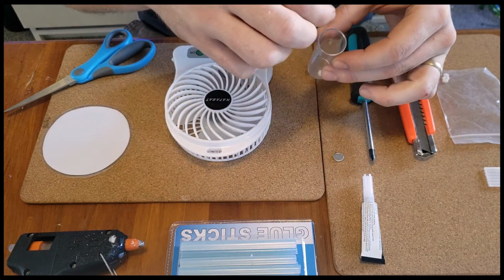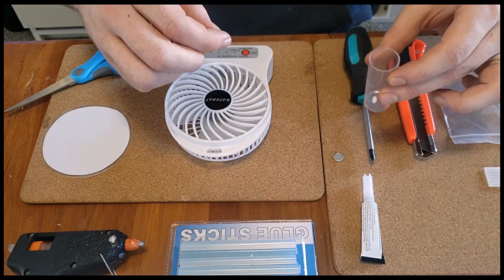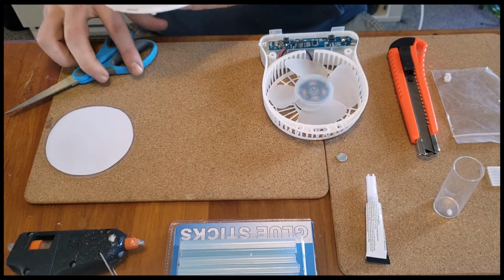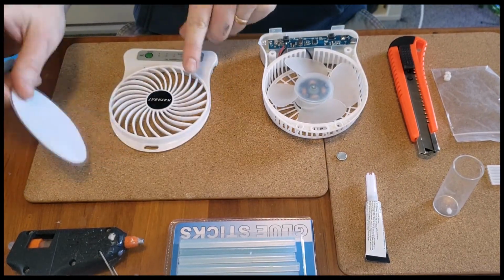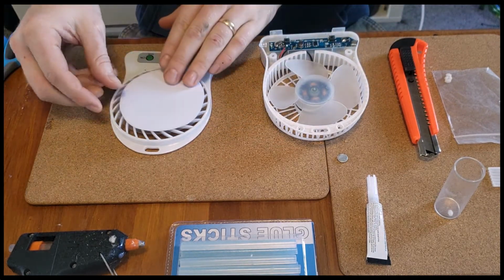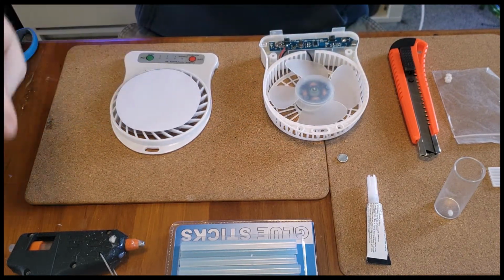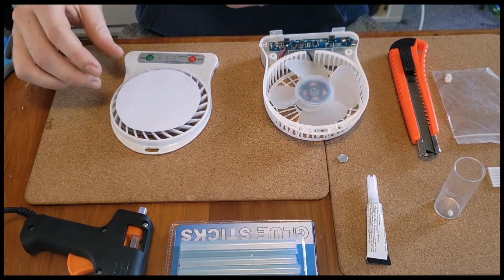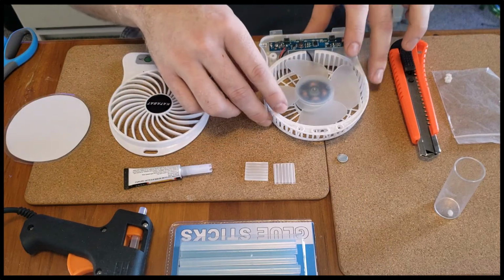a plastic magnetic bead which you can get from Amazon or AliExpress, a waterproof membrane layer. I'm using a plastic white piece of paper that's laminated, and then finally you're going to need a fan, and I've gone for a 5-watt USB rechargeable $20 fan unit.